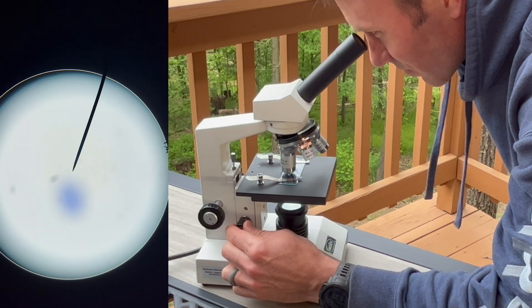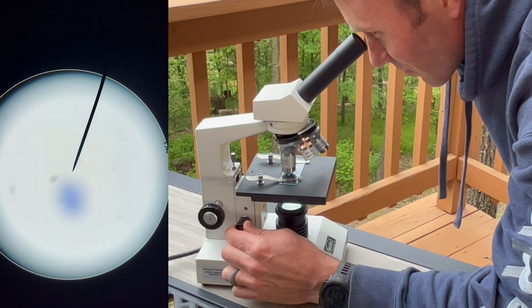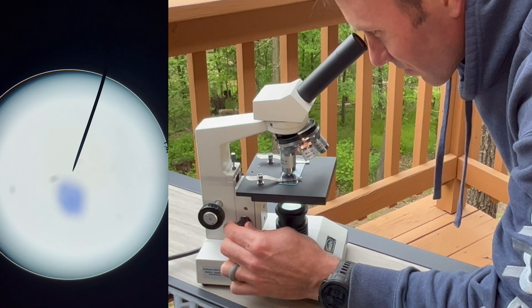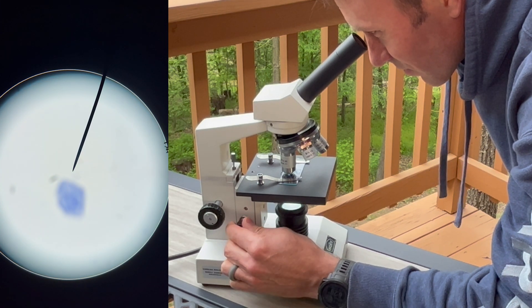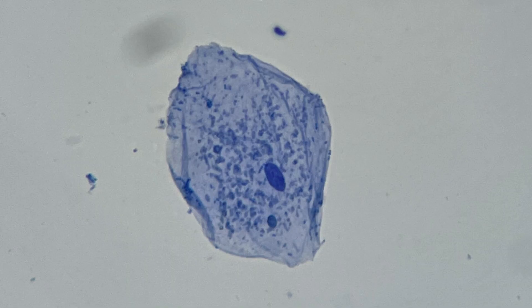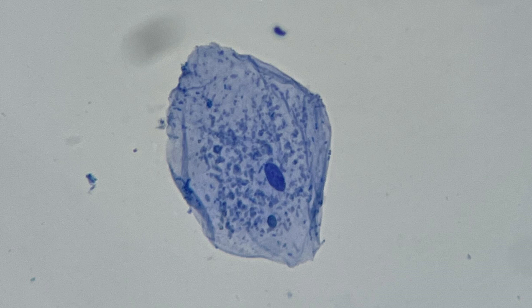Once again, the fine focus knob is used and the image becomes very clear. What a beautiful sample — a human cheek cell, generally roundish in shape and with a nucleus.